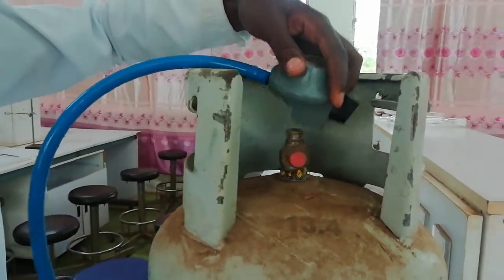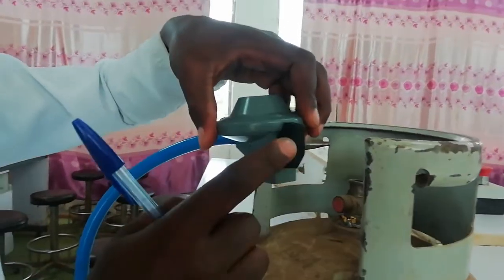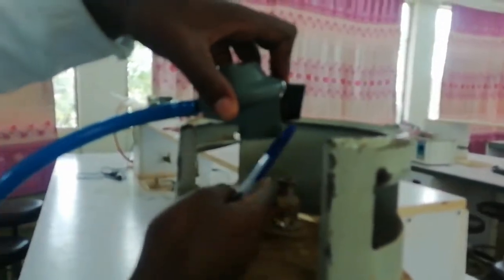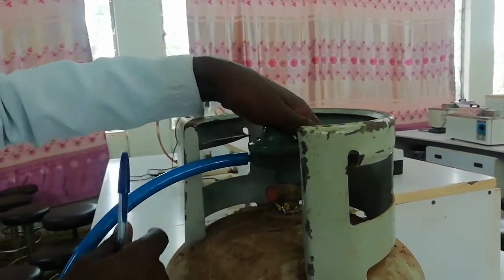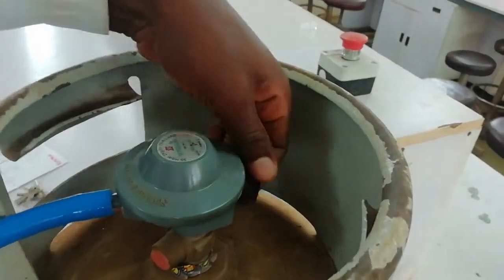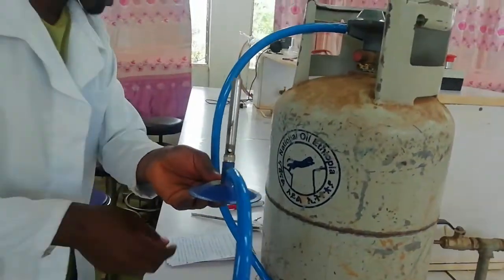Connect this Bunsen burner to the jar which contains hydrocarbon gas. This is a valve which opens and closes the gas flow. If it is opened, the gas starts to flow from the jar to the Bunsen burner. If it is closed, the gas stays in the jar. To open, just rotate it down — now the gas starts to flow out.